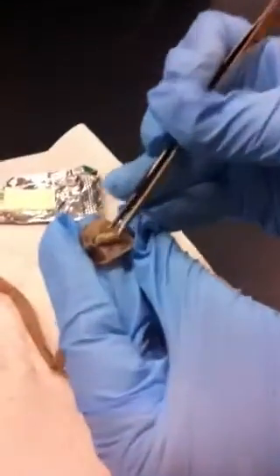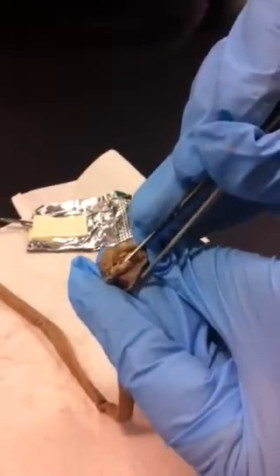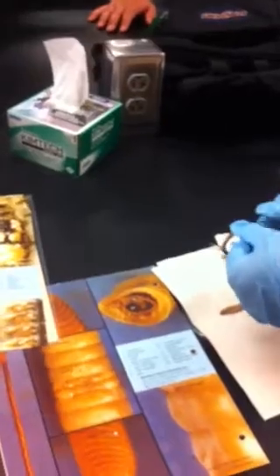So if you look inside, they're actually tiny. See, they're right there. Right? The small ones. Again, if I'm going to show you something like this, I'm probably going to show you something like that, and then just pinpoint one of them. I'm not going to use a thing, because to me it's not fair that you've only seen it one time and think that you could know everything about it. That's not for me to do.